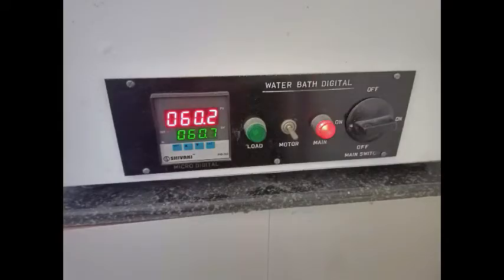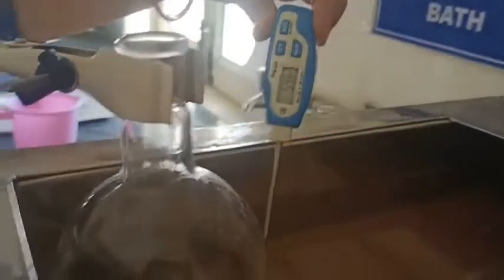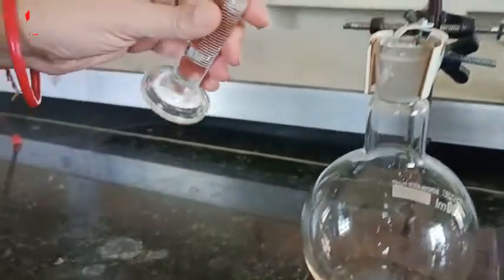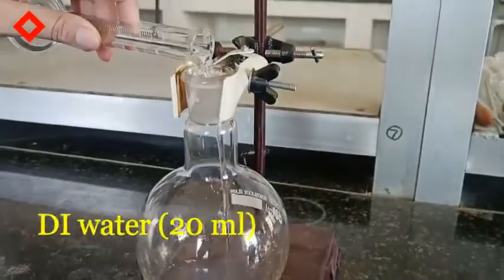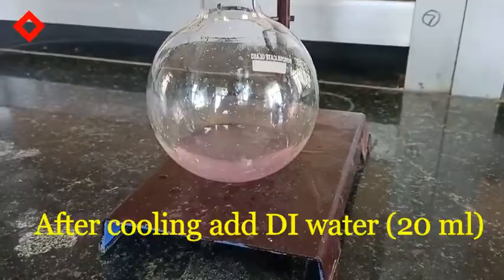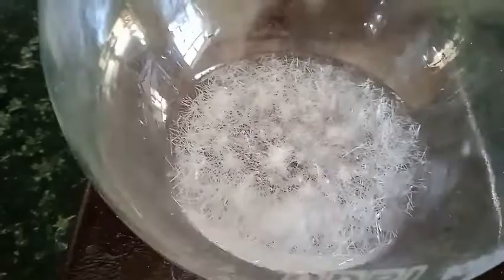When it reaches 60 degrees inside the water bath — around 58 to 59 degrees centigrade — we leave it for 10 minutes. After removing it from the water bath and cooling to room temperature, I am going to add 20 ml of distilled water to this mixture. After some time we get beautiful crystals in the reaction mixture — needle-shaped crystals.